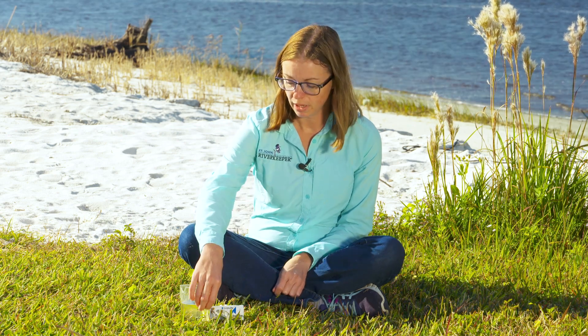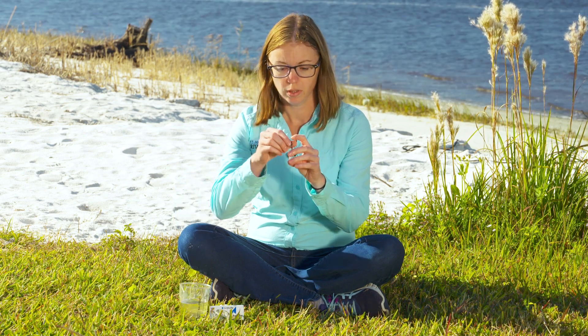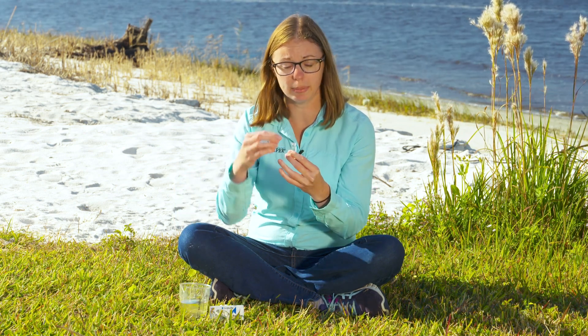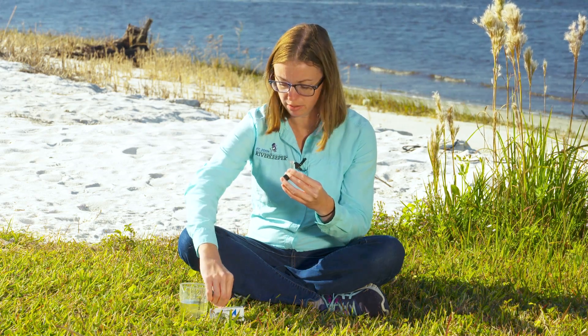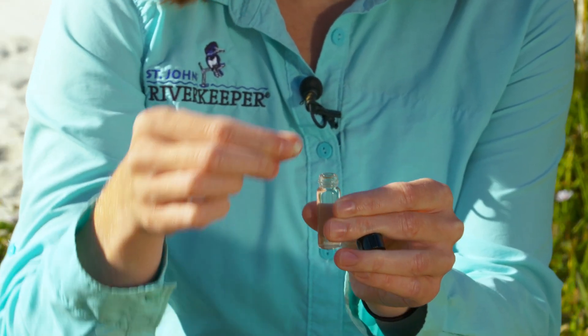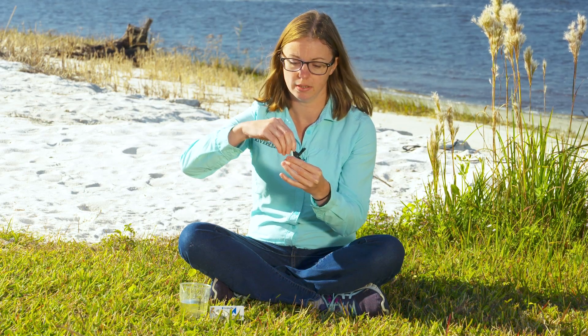Let's test the dissolved oxygen levels. I collected a river sample earlier and have filled up my vial. I'm going to add two tablets into my vial — there will be some overflow of water. Then I'll cap it and invert until the tablets dissolve and wait for the color to form.